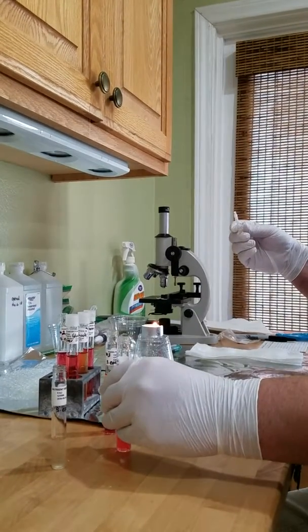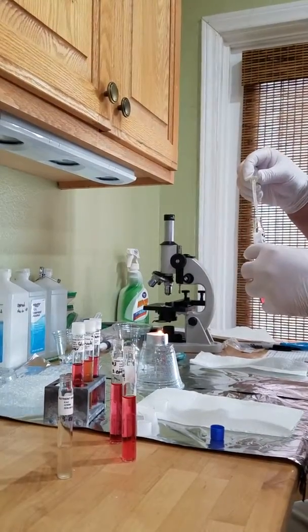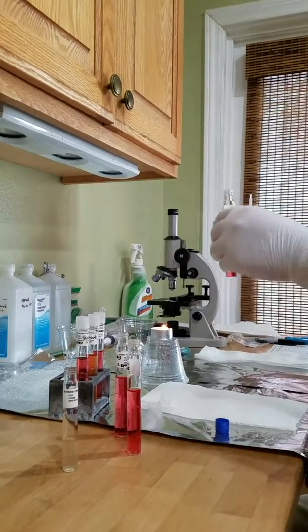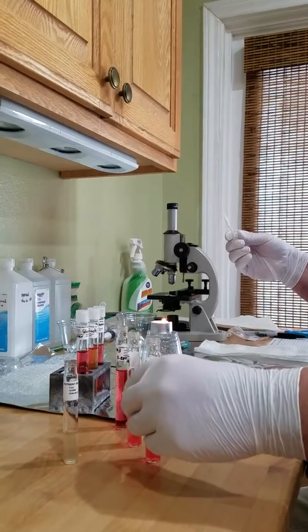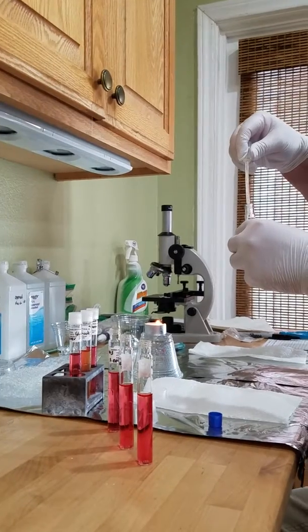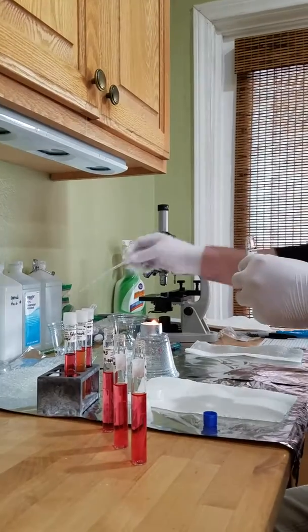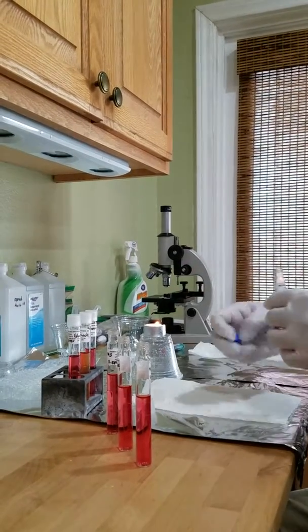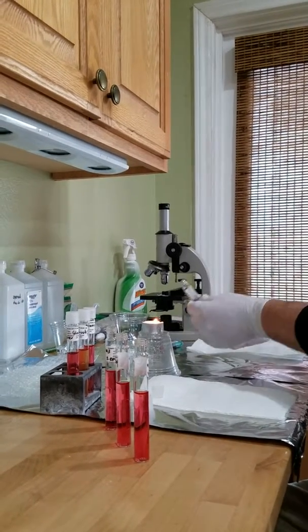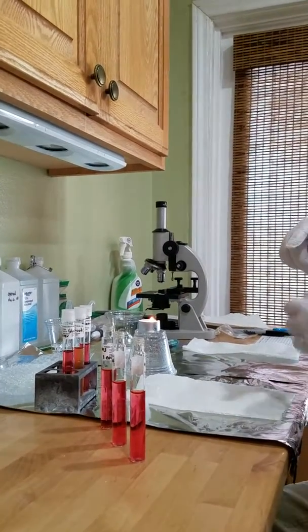Four drops of that one. Four drops of that one. Into the alcohol for you for disposal. Let's flame you back on. Nice and tight.